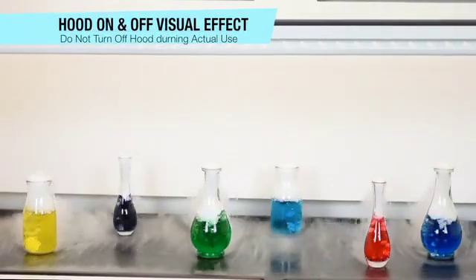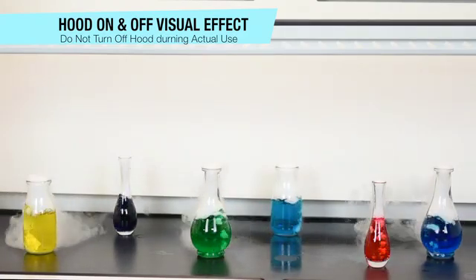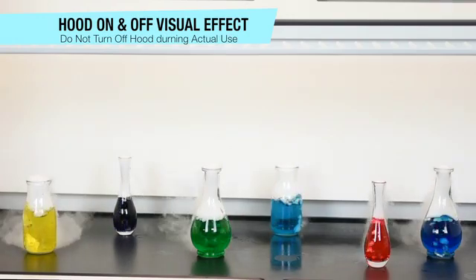Alright, let's take a look at a properly functioning hood. As you can see, the fumes were exhausted very quickly when the fume hood was just turned on. Now, it's very important to always start with your hood turned on, but we're just doing a visual example.